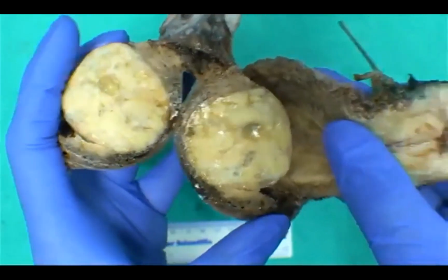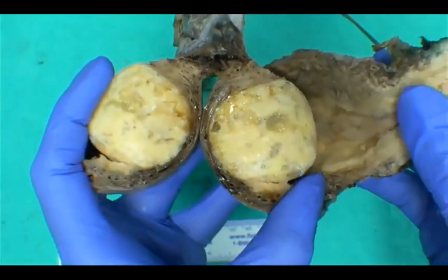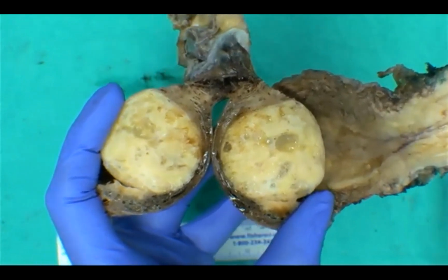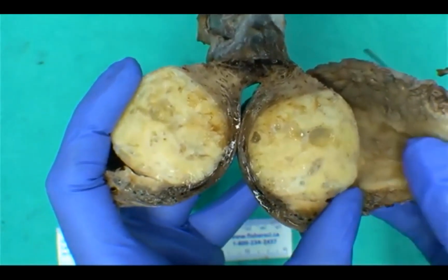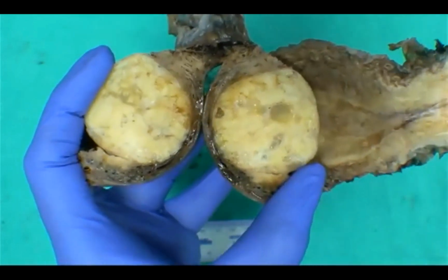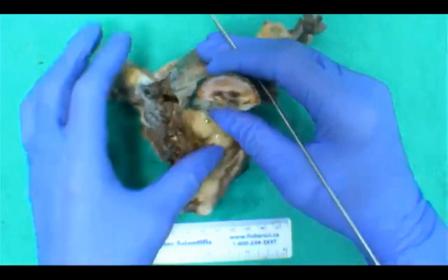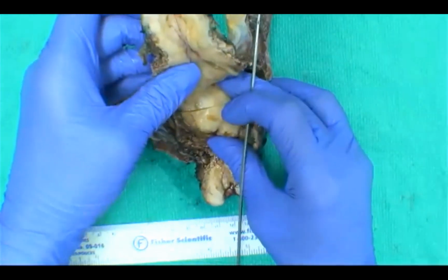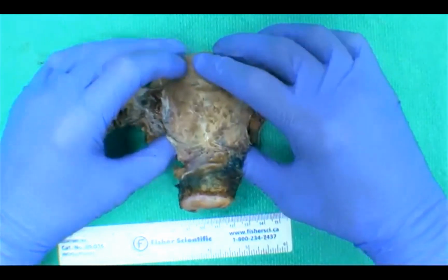So great. Whenever you have a larger fibroid in your uterus, you always want to look out for any signs of necrosis, which can appear as chalky yellow areas, or any areas that are overtly hemorrhagic. For grossing the specimen with what we think might be a fibroid, you would still do your initial measurements of the specimen overall.